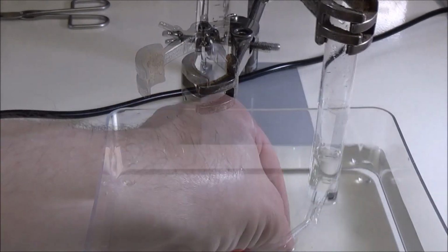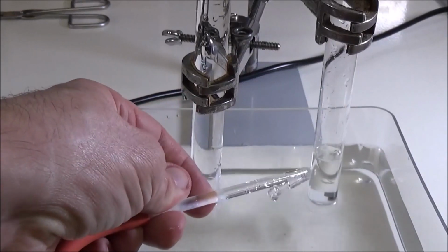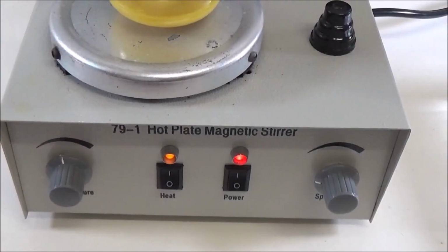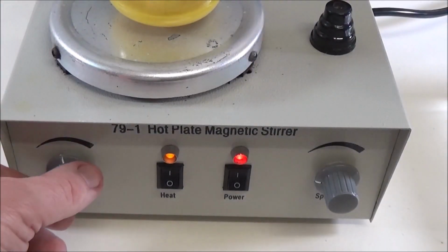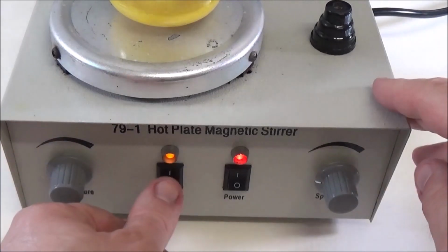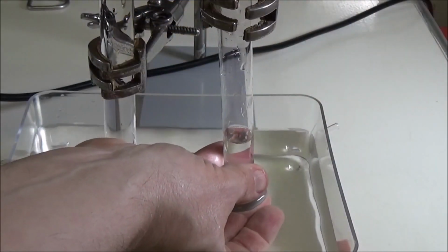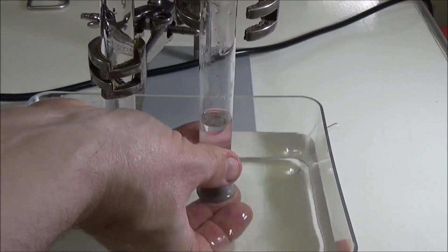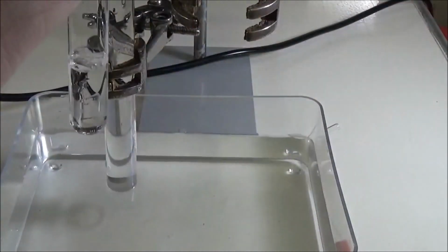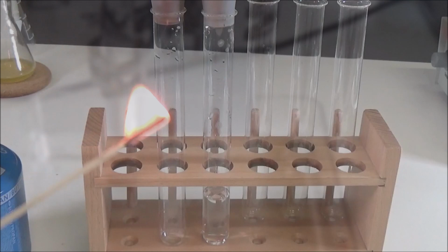Since the barium peroxide was used up before the test tube was fully filled with gas, some water remained in the tube. In order to prevent cold water from destructively rising back into heated equipment, the gas supply line must always be removed from the water before the heat source is switched off. Now the last filled test tube was closed underwater and removed from the apparatus. Residual water that has not been displaced remains in the glass.